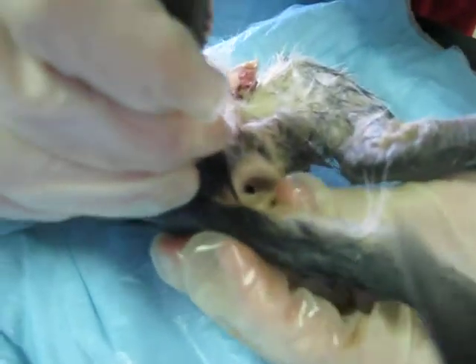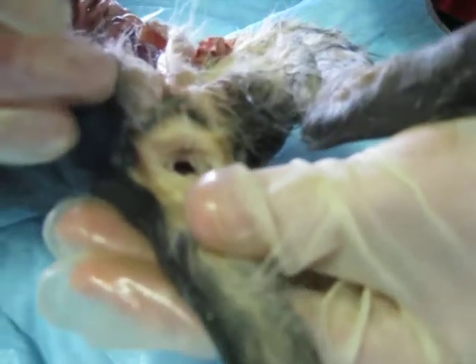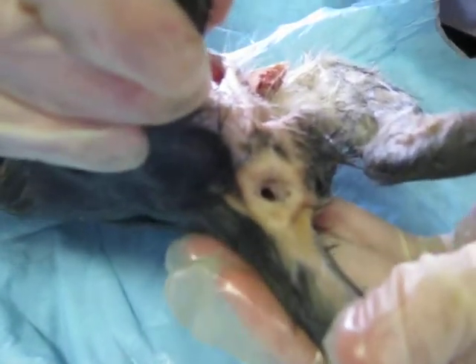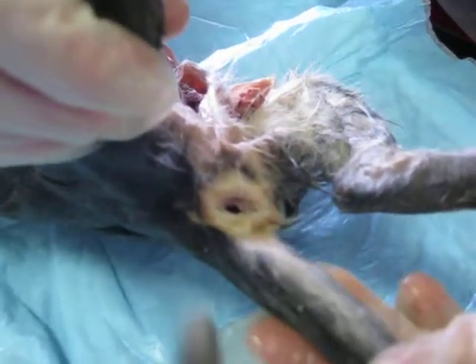After that, you get to the anal glands. There are two on either side of the anus, and they secrete oils that help to pass waste outside of the cat, and they also excrete different smells for marking territory and showing fear.